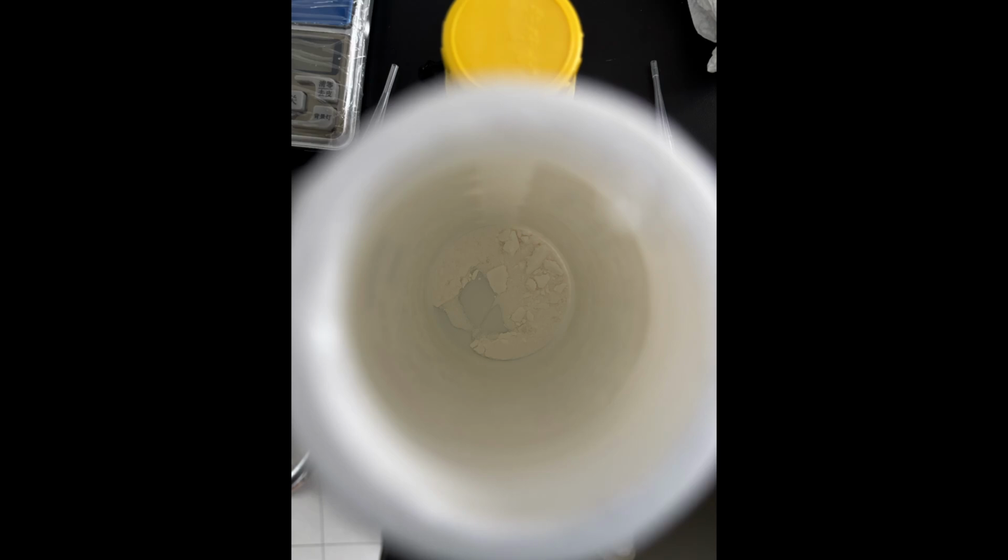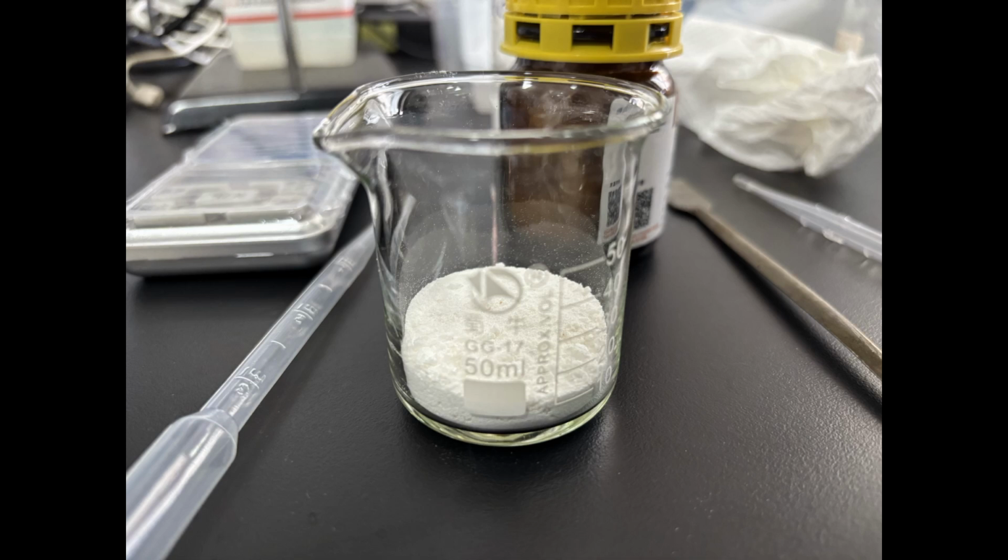A few weeks later, I found out that a lot of white solids remain in my bottle of DCM when the DCM all evaporated away. I thought that this is also my product, so I ran a TLC with my first batch of product and a standard sample of 4-bromophenol. The result is rather disappointing, as the spot of 4-bromophenol didn't appear in any of the 2 other samples.